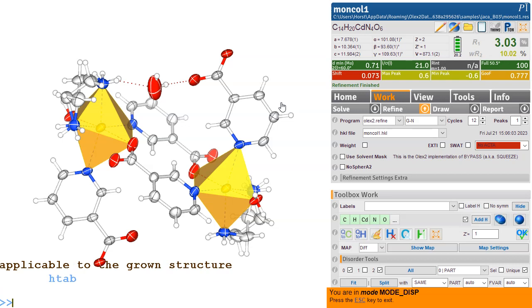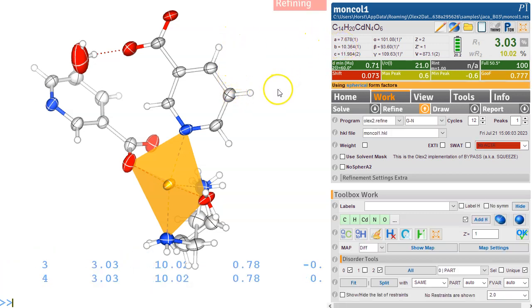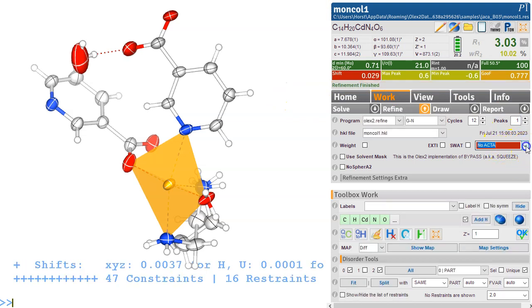It is not applicable in a grown structure, so we need to do fuse first, HTAB, and then the hydrogen bonds will be listed in the CIF file and evaluated. So we're nearly done. Obviously, for a CIF file we need ACTA on to get a CIF file.